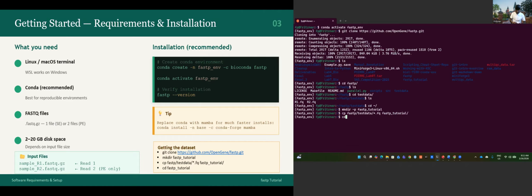Now let's move to this directory to see if we successfully copied everything. Let's ls. Voila, we got the R1 and R2. Okay, we can move to the next step.